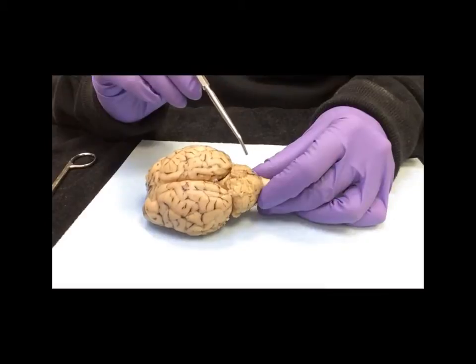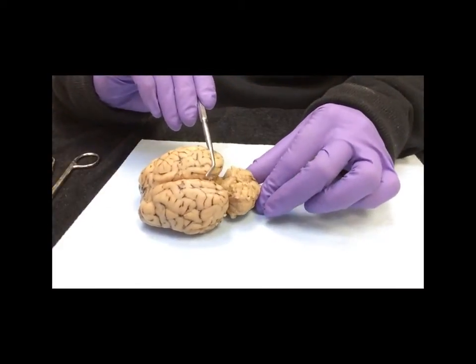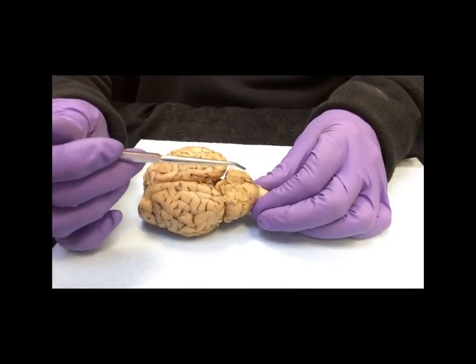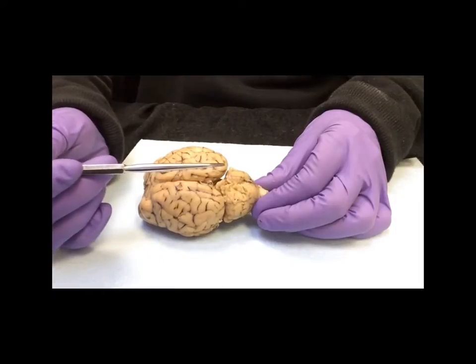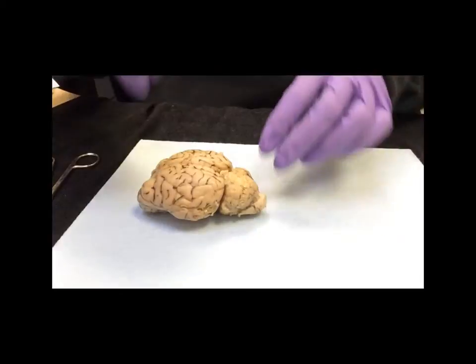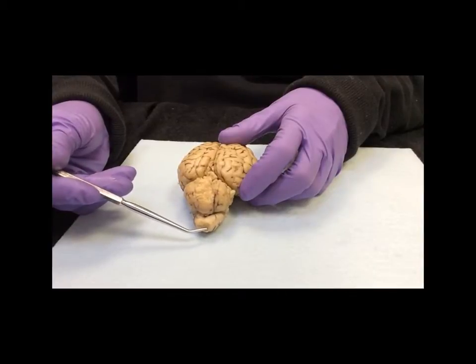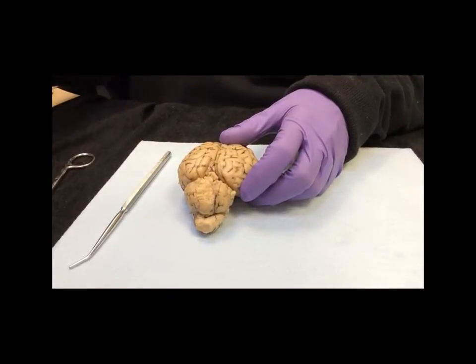Looking back here is the cerebellum. You can see that it's separated from the cerebrum here. So the cerebellum, although not looking too good here, you can see that there are 2 cerebellar hemispheres, and then in the area in the middle here called the vermis. Further down, looking at the caudal end of it, you have the medulla oblongata, and this one has been cut short, but had it extended, it would have been the spinal cord.